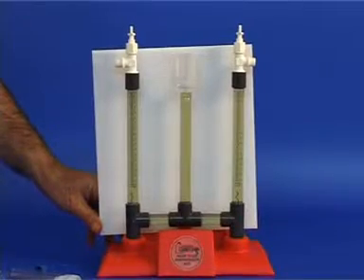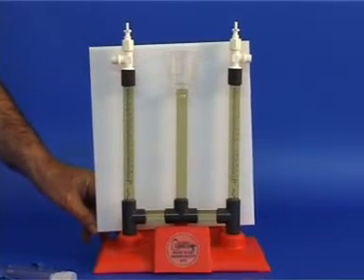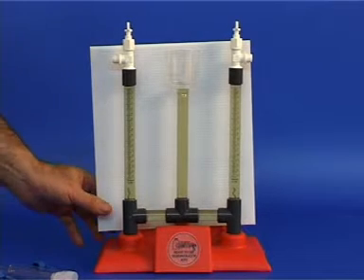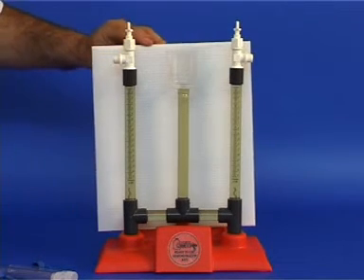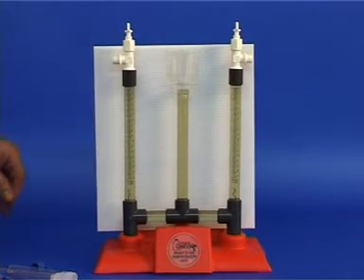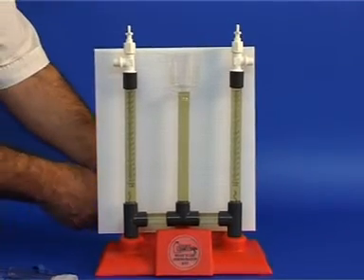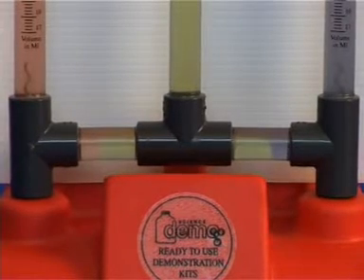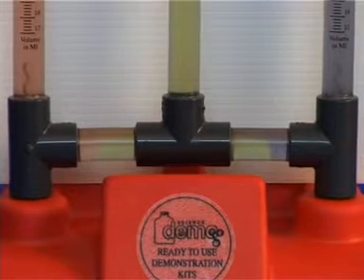The same solution can be used many times provided you do not add an indicator. This is what it looks like when an indicator is added. The apparatus consists of three vertical tubes connected by a horizontal tube. Notice the electrodes in the solution in the outer tubes at the bottom.